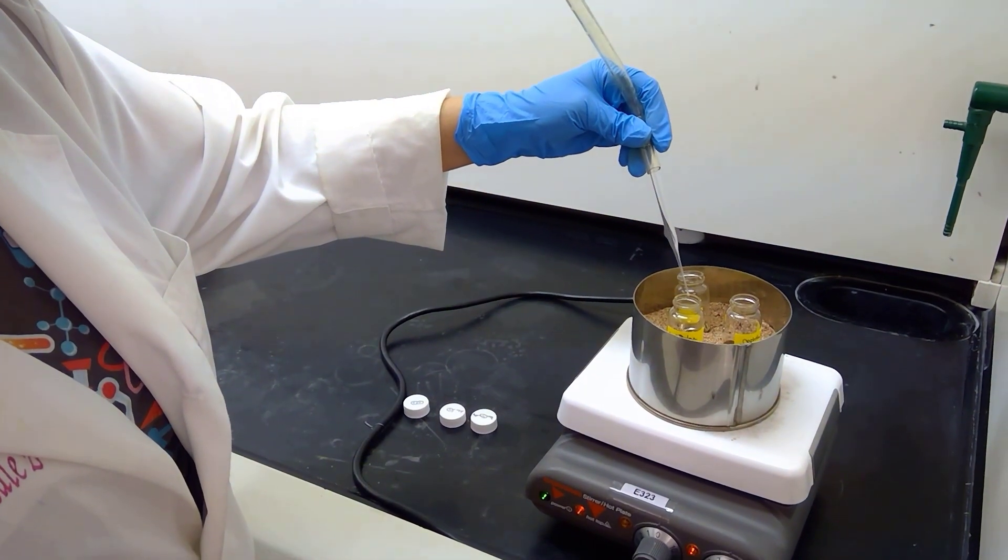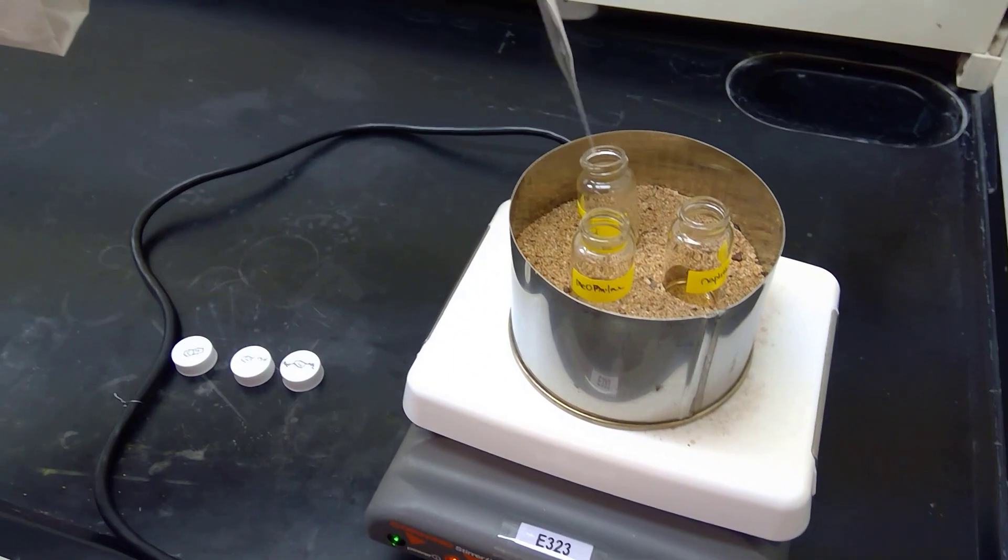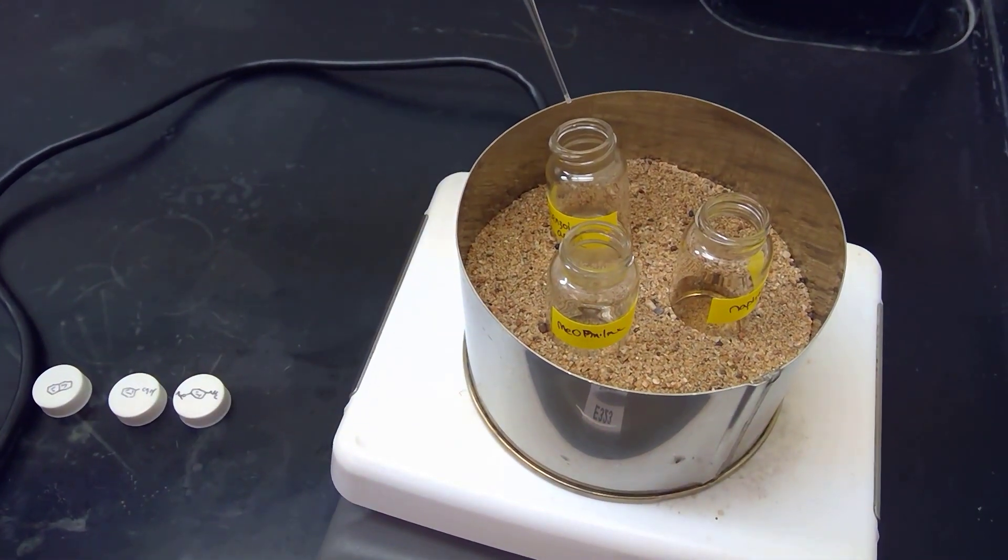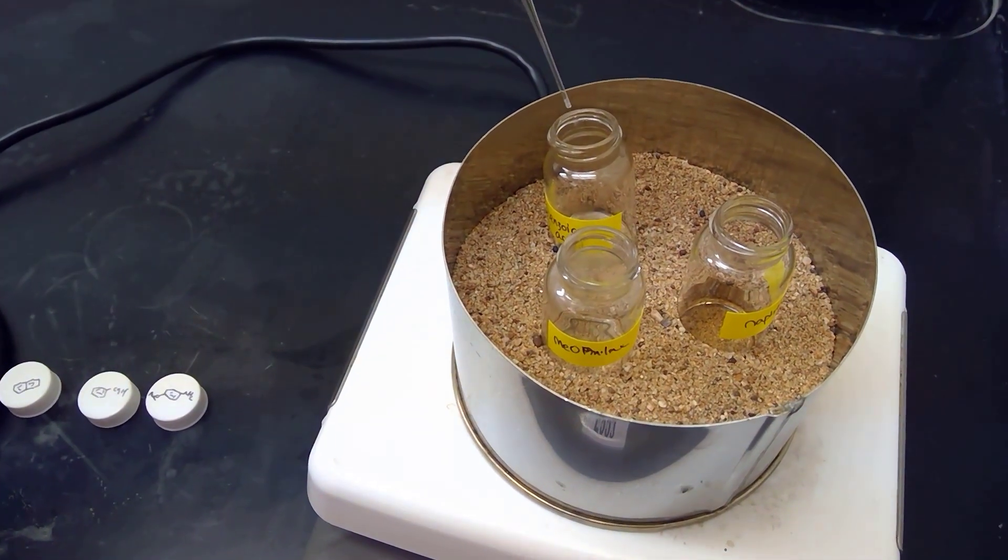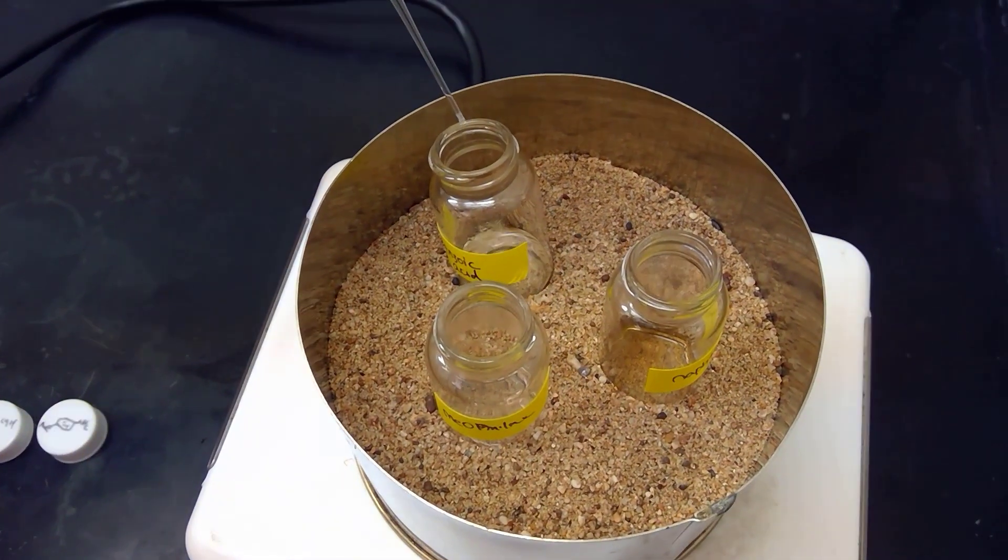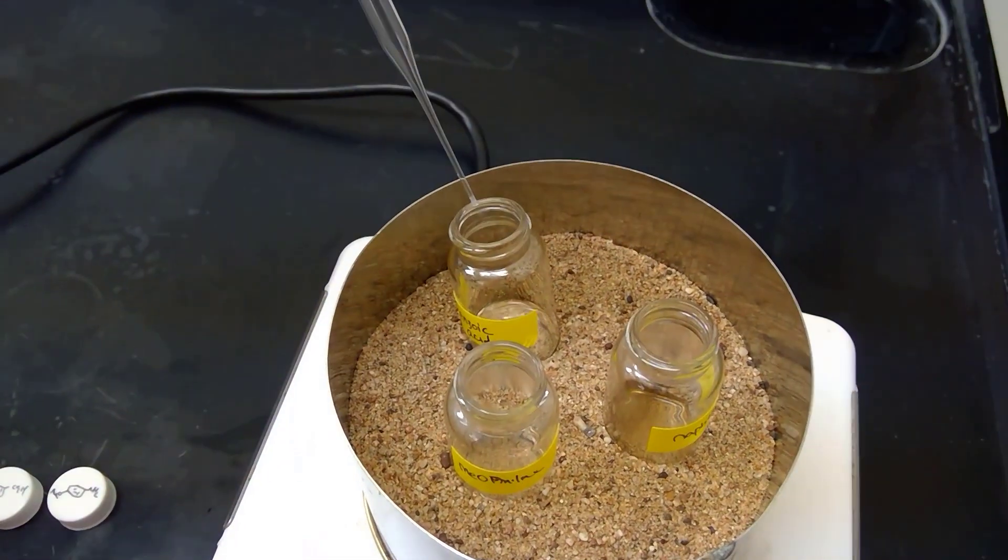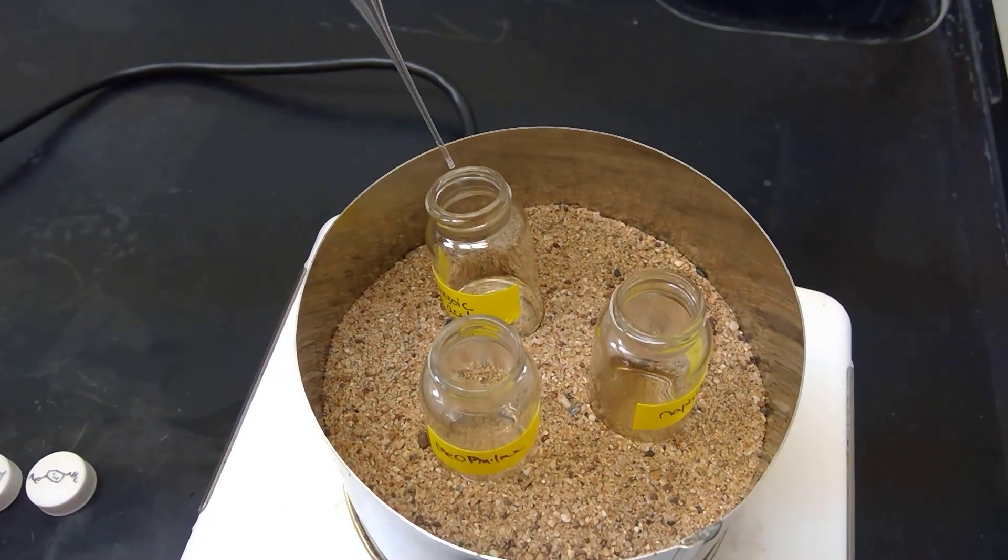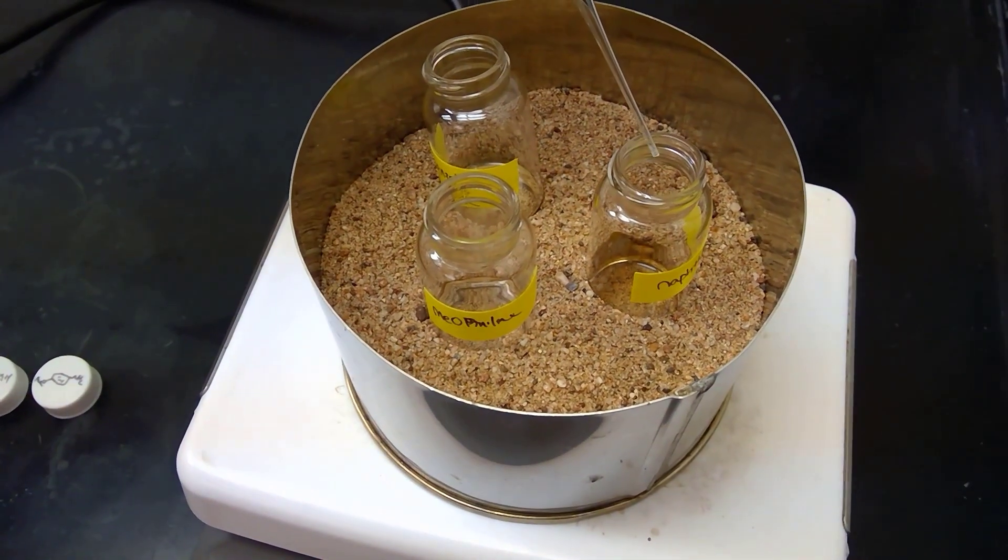Okay, so this is going to take a little bit, but I'm going to ask Lee to put the camera over the samples there so you guys can see, have a little bit of a visual look at how much sample is in each scintillation vial there and how we are getting these guys to evaporate. It's a very small amount of air coming through the test tube there. All right, we'll be back in just a few moments once we get these samples evaporated.